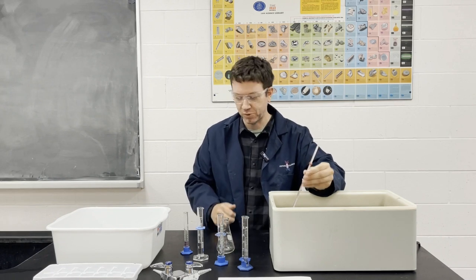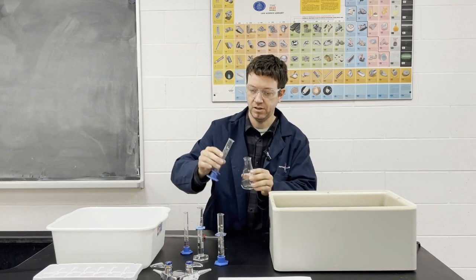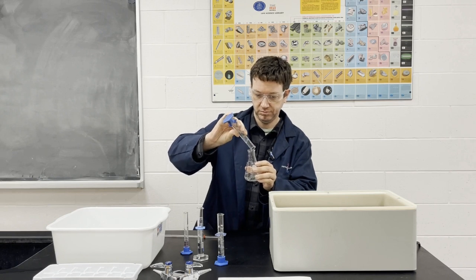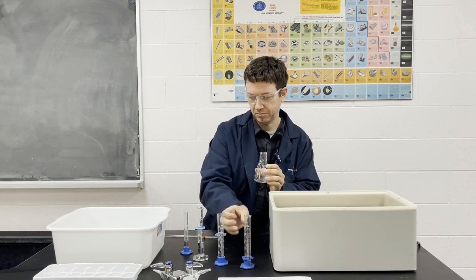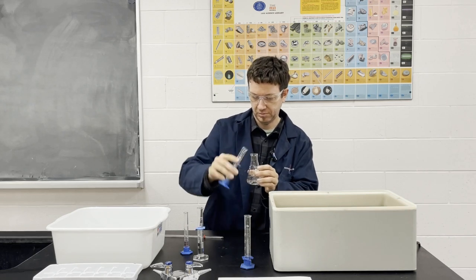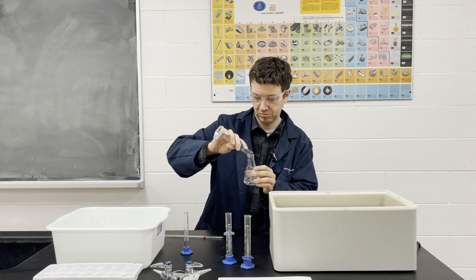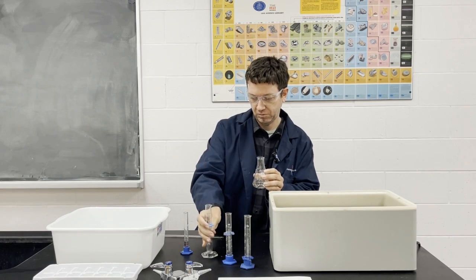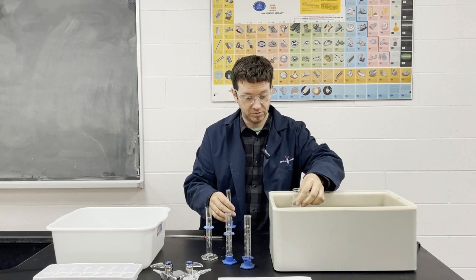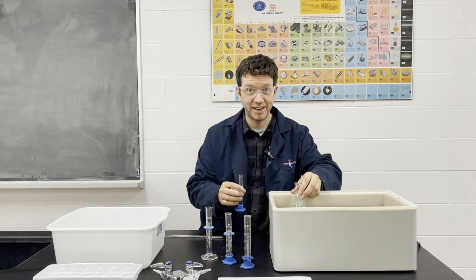So let's start with this one. And now we're going to come closer so we can observe.